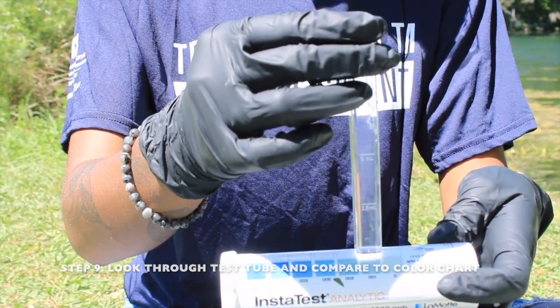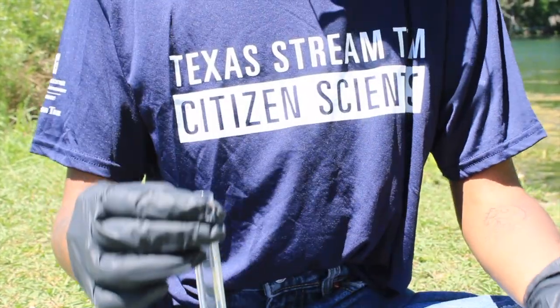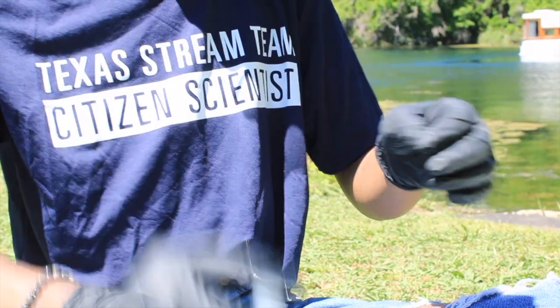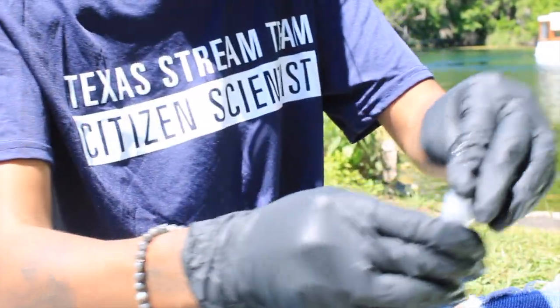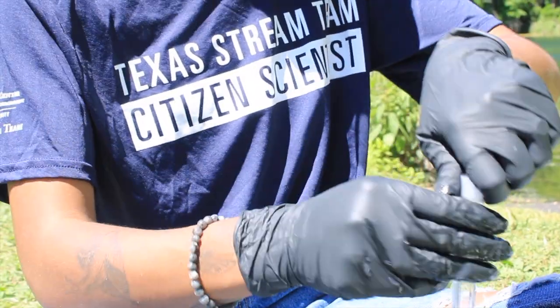If the test result is less than 700 parts per billion, record the result on the advanced monitoring form as parts per million or milligrams per liter. If the test result is greater than or equal to 700 parts per billion, refer to the field guide for further instructions. Dispose of the sample water in the waste bin and rinse the test tube and cap 2 times with DI water before storing.